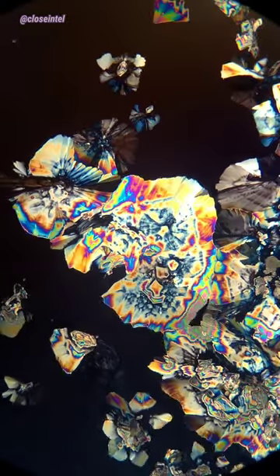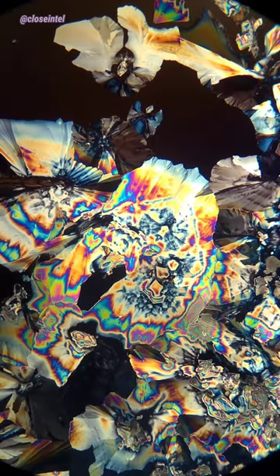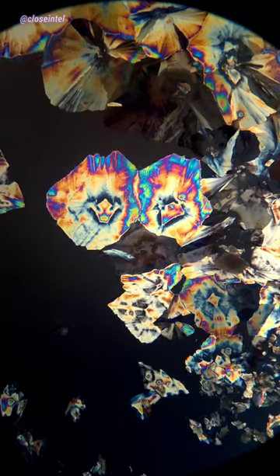Let's take a look. As the alcohol starts to evaporate, it leaves behind the acetaminophen, or Tylenol, and forms the bright crystals you see here.